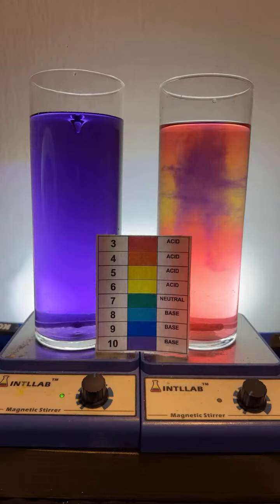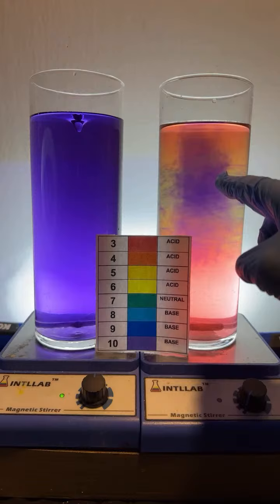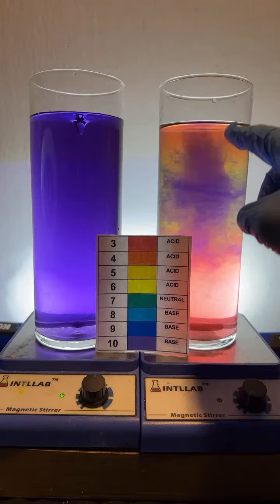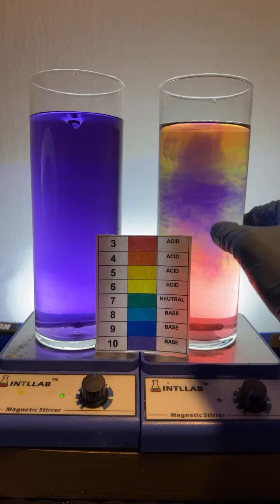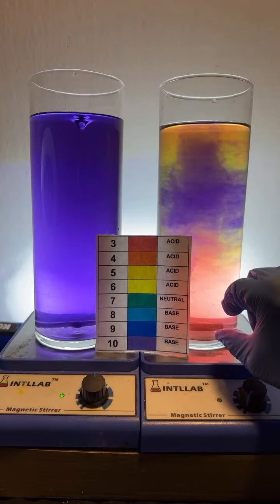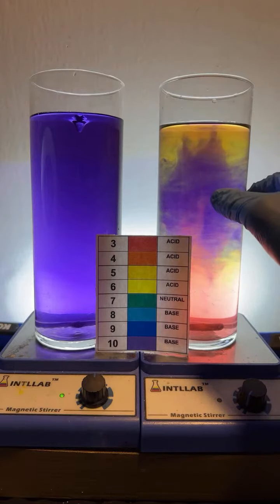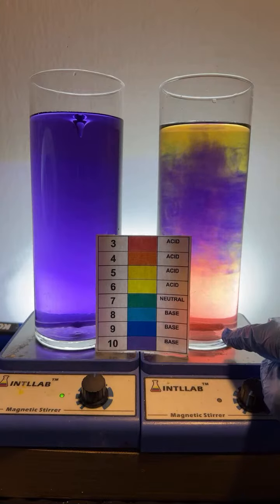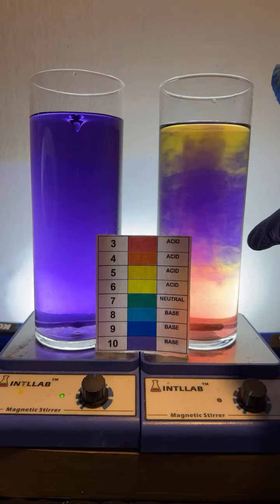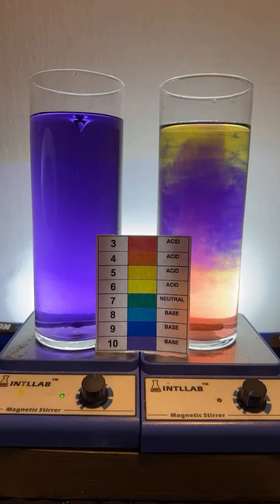Now, what I think is going on here is the base is quite dense. And so the base is going to sink. And of course, as it sinks, it's going to neutralize the acid. And as it continues to drop, it should end up here on the bottom. But as it moves through, it's going to neutralize some of the material. And then down here at the bottom, you'll have the base, and that'll displace the less basic material that should end up on the top.